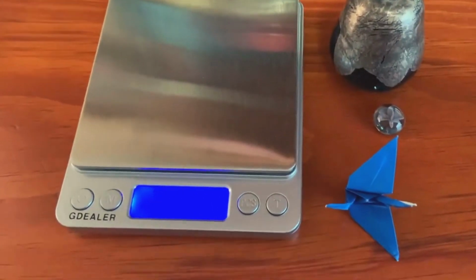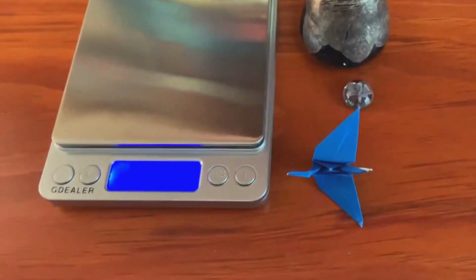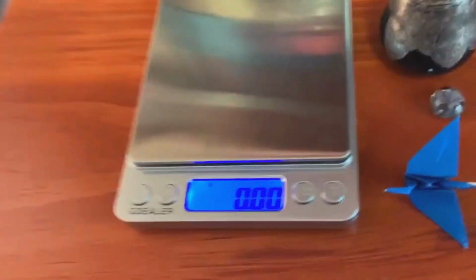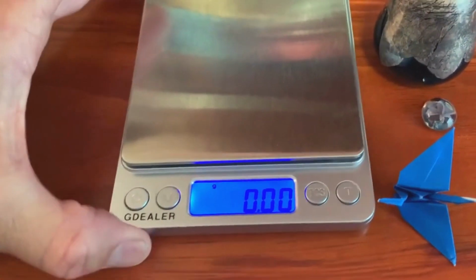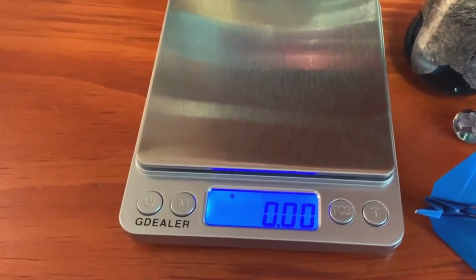This is a relatively simple experiment. However, there's a couple of things you need to do first. First of all, when you're using your balance, you need to make sure that your balance is on a flat, level surface. Okay, if it's not, it's not going to read correctly.